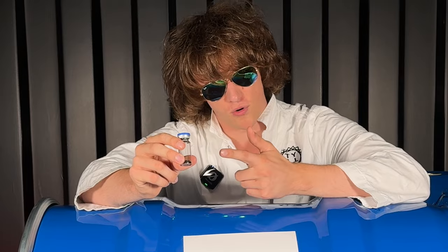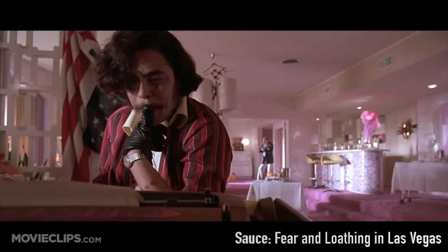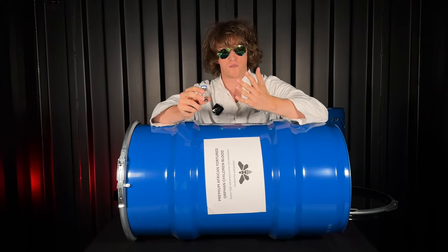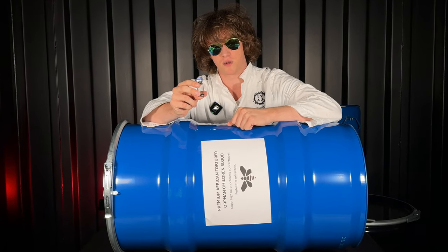Today I'm going to show you how to make Adrenochrome. Adrenochrome is a controversial substance that led to many conspiracy theories. So, what even is Adrenochrome?